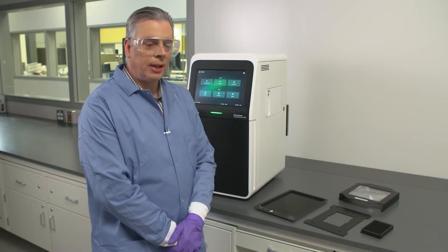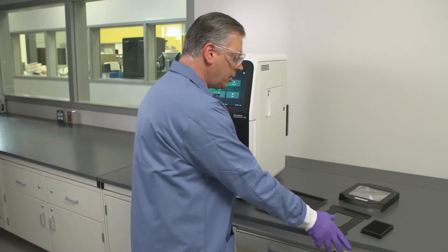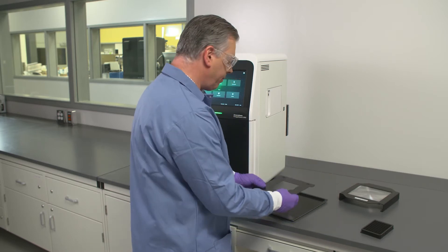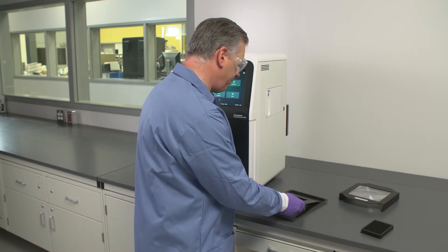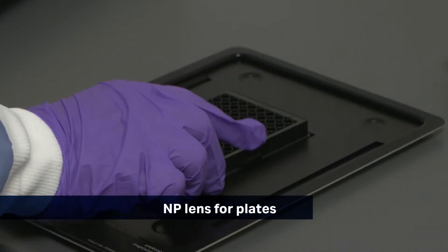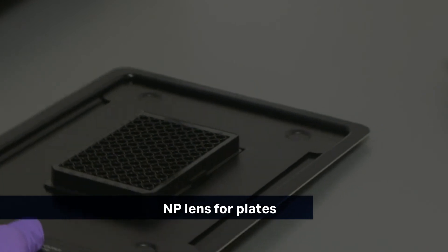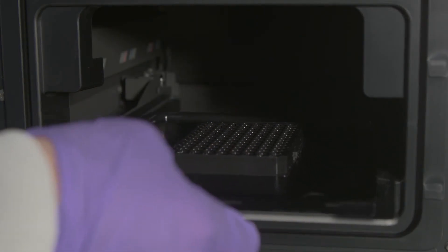In this session, we're going to look at how we can image a micro-titer plate using ImageQuant800. We're going to need an accessory which comes optionally with the system. We then take our micro-titer plate, place that in the middle of the template, and we're going to place this now into the lower position on the imaging system.